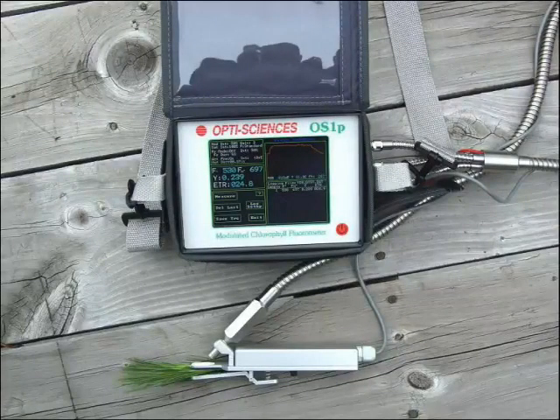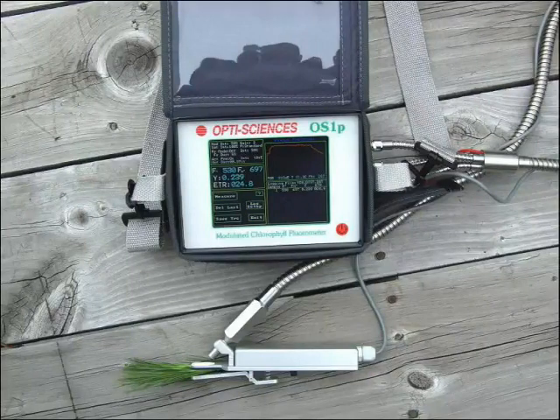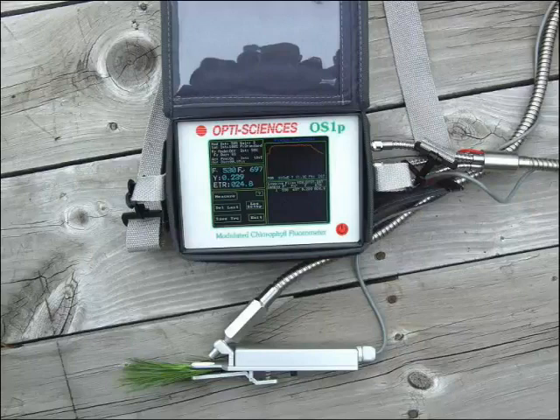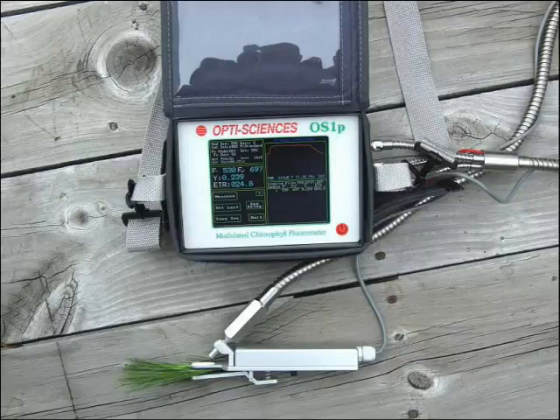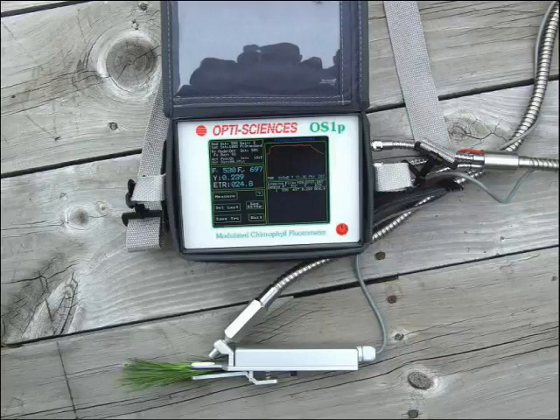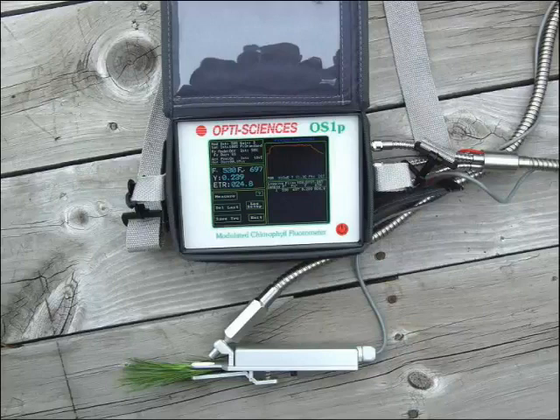It replaces the OptiSciences OS-1FL, an instrument known for its rugged design, light-adapted yield protocol, affordable price, and reliable scientific results. The OS-1P raises the technology bar in several important areas.